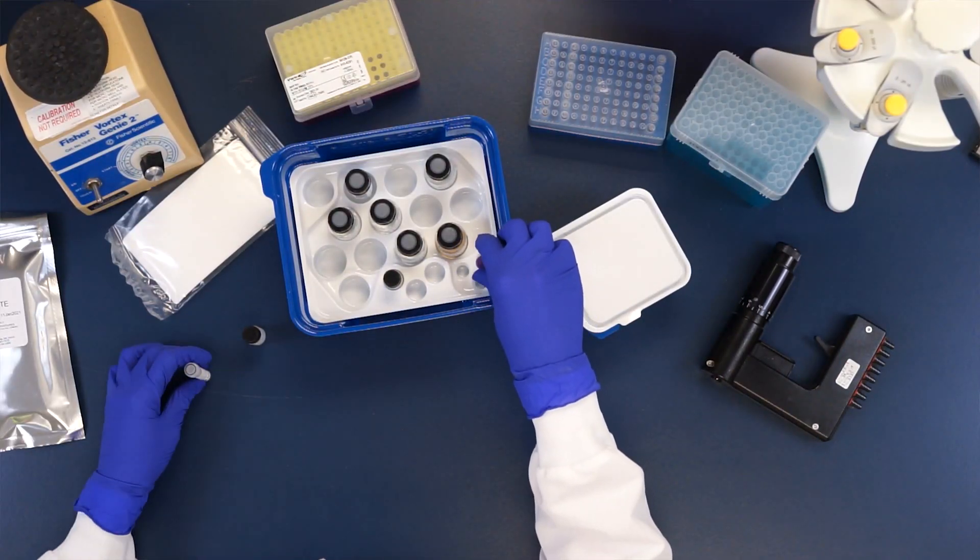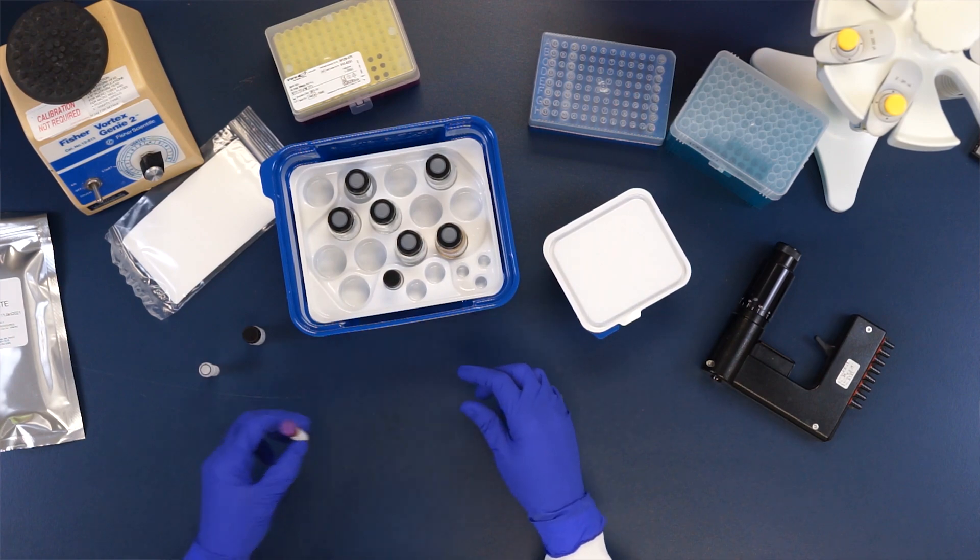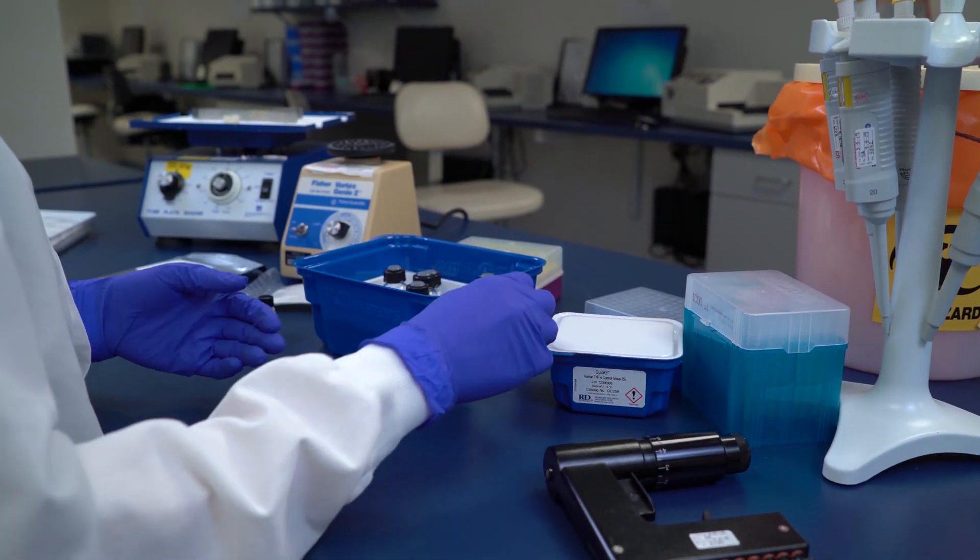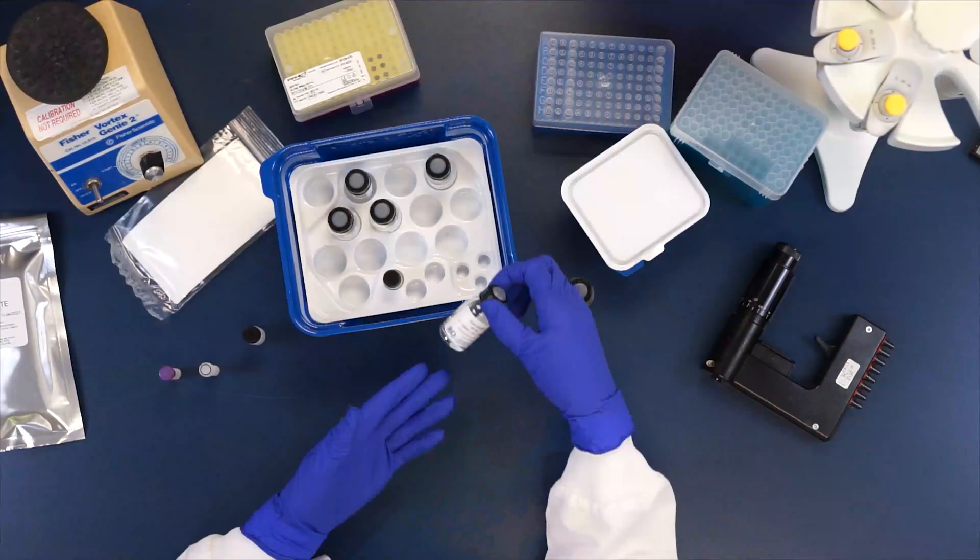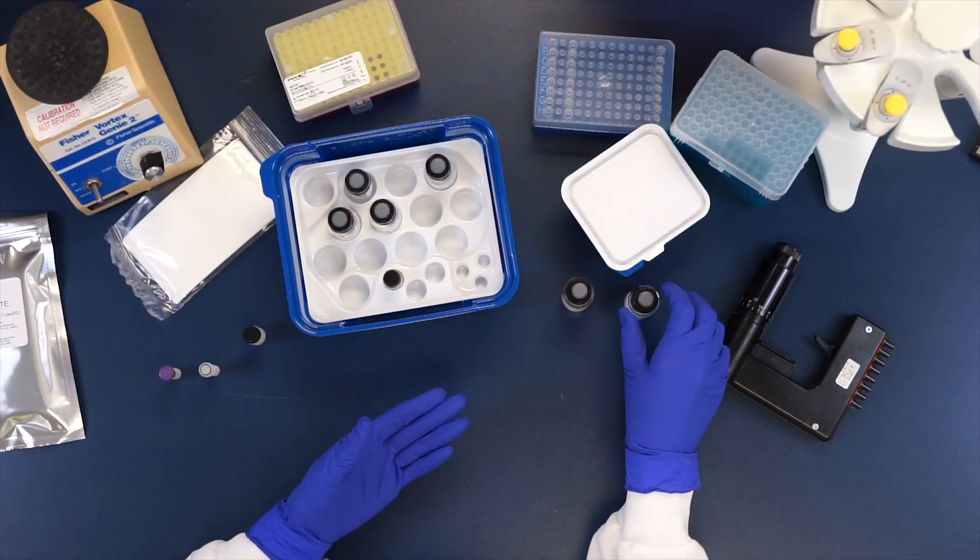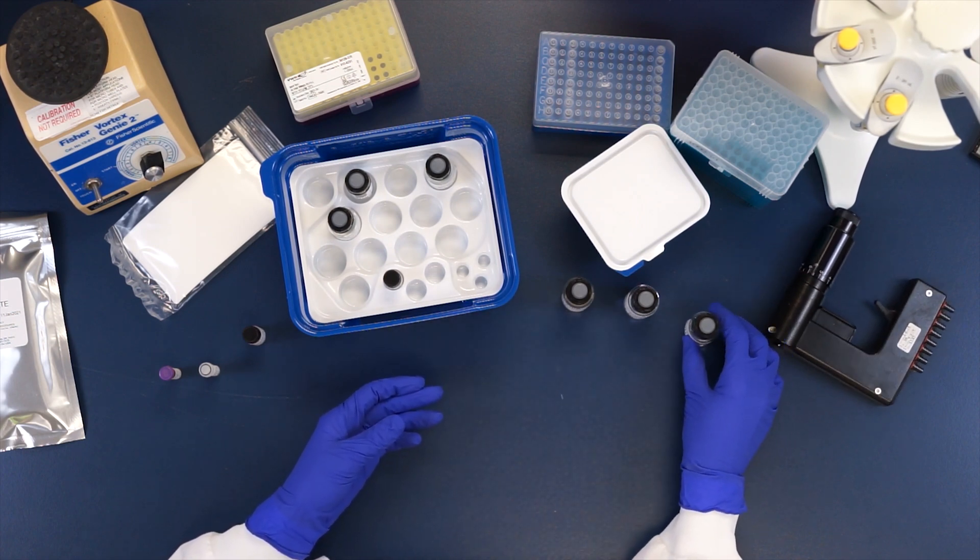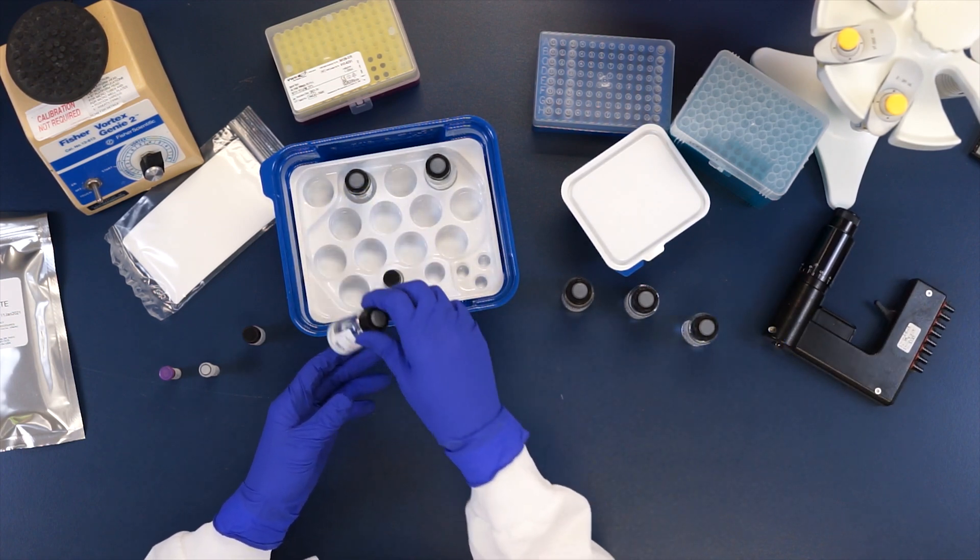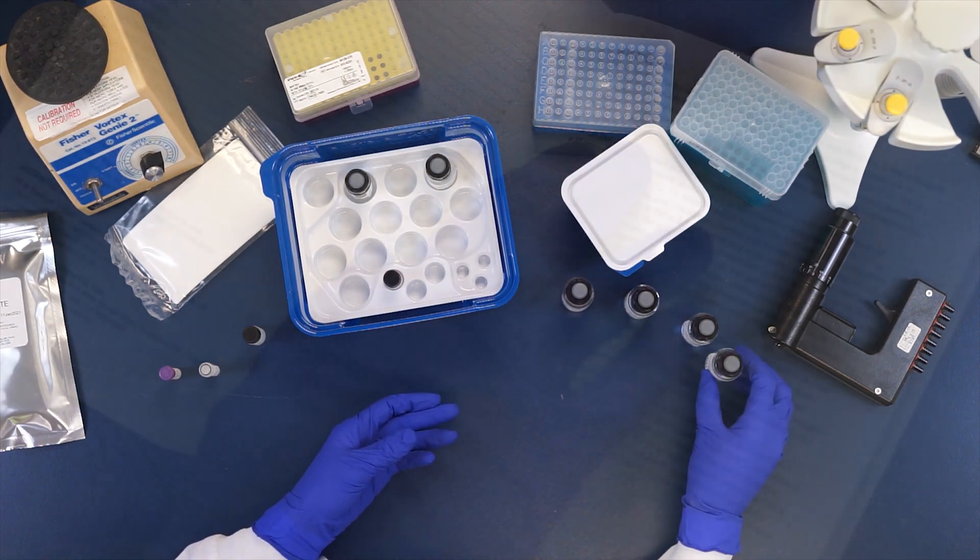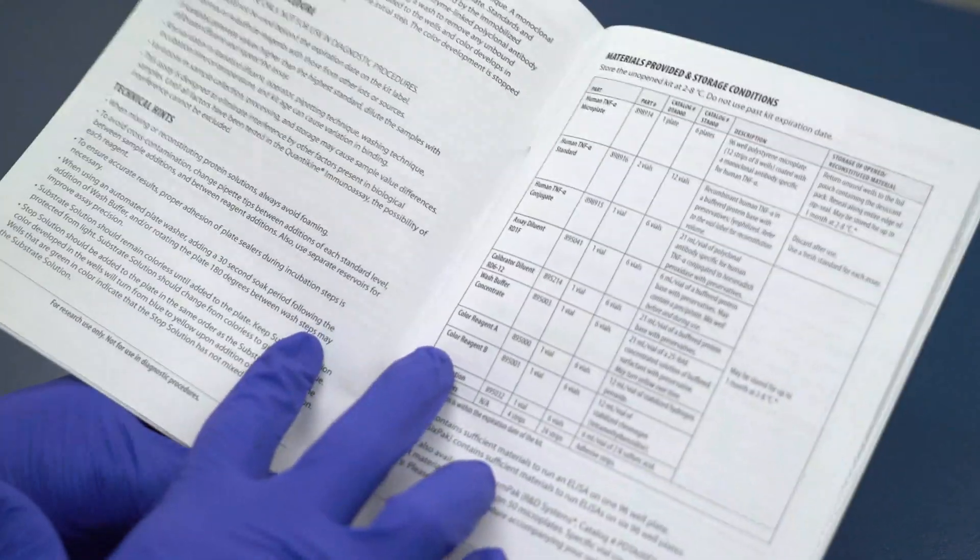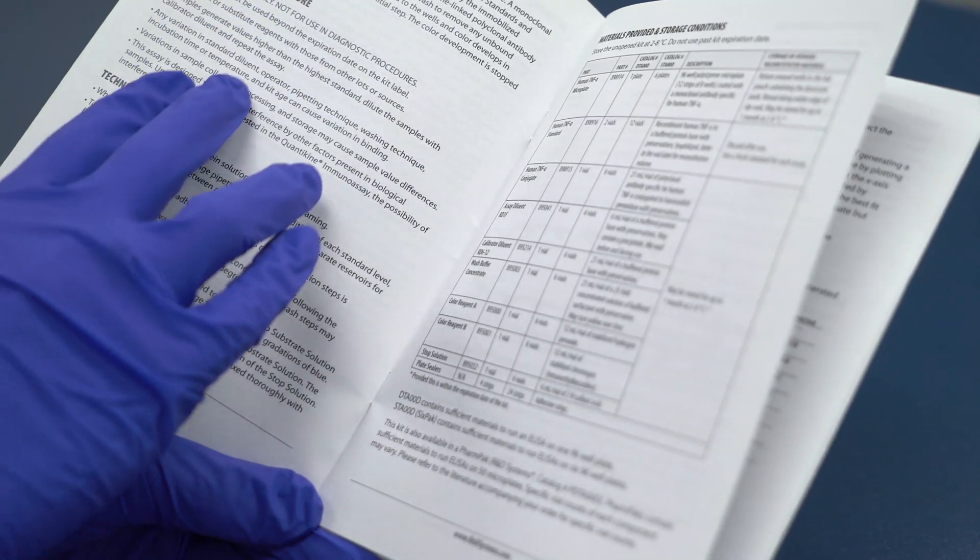There are a few important things to keep in mind before we begin. First, some proteins are detectable in saliva, so it may be important to wear a face mask to prevent contamination. Refer to the precautions section in your kit booklet for specifics. Also, be sure to wear personal protective equipment and refer to the safety data sheet on our website prior to use. Finally, protocols vary by kit and sample, so read your kit booklet carefully before you begin and during each step for specific instructions.